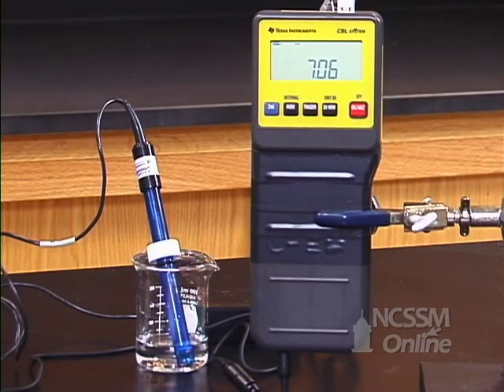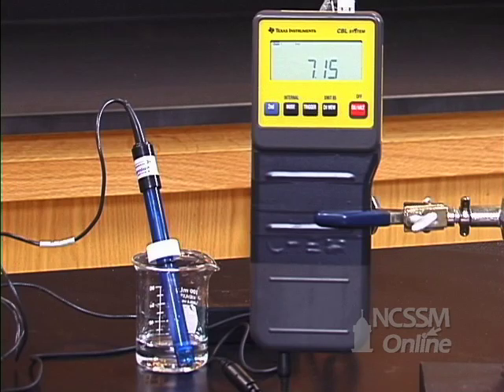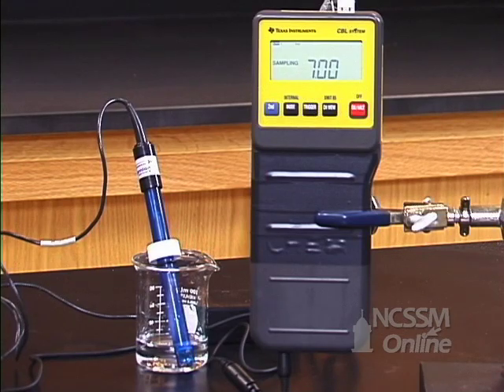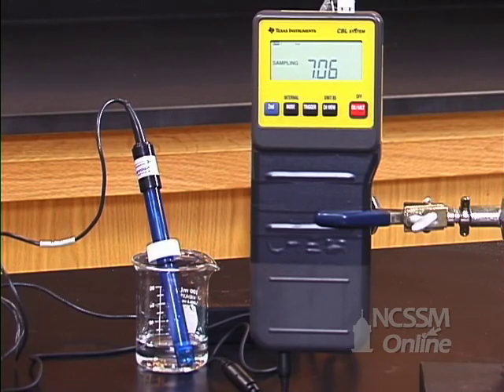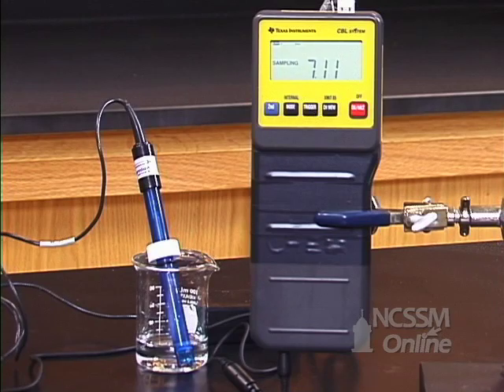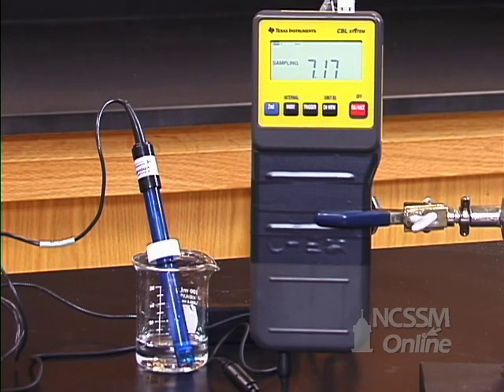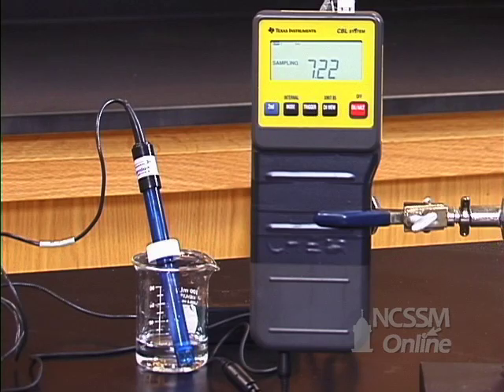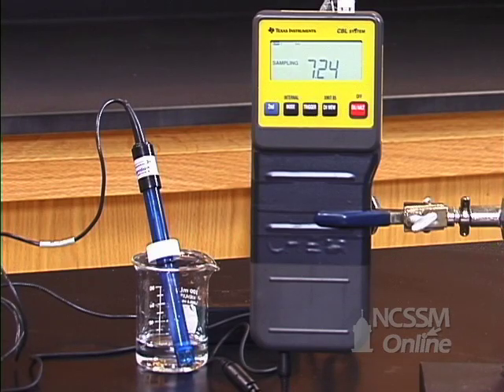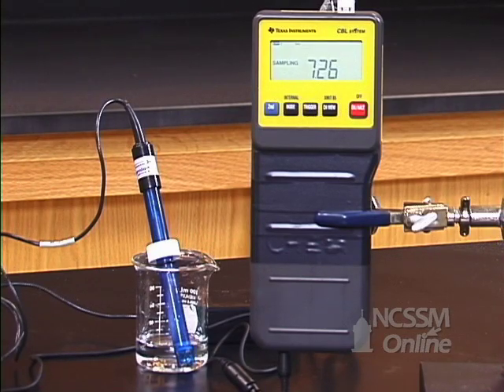We're going to look at the pH of a number of buffer solutions and see how the pH changes as we add acid or base. We're going to start out, however, looking at a solution that is not a buffer, which is pure water.